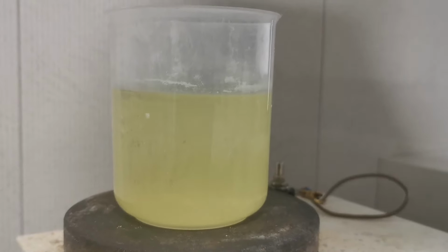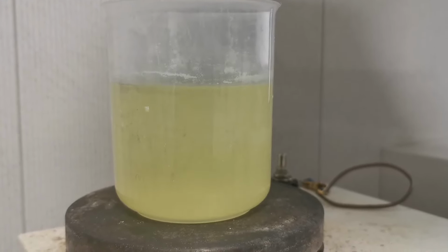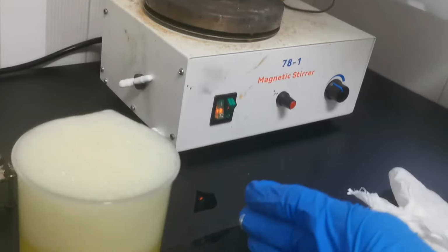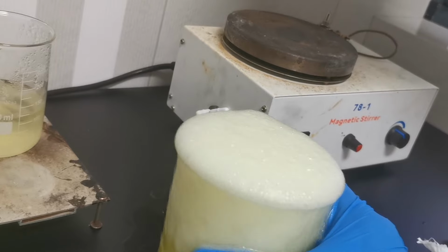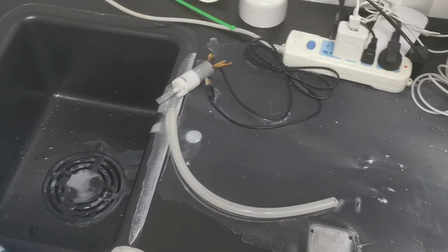And as you probably guessed, it led to a runaway reaction and subsequently a disaster. The foam flowed out of the beaker and onto my lab table, and it kept releasing a bunch of hydrogen chloride as it went. I turned my vent fan all the way up and ran out of the lab, and after a few hours of coughing because of all the hydrogen chloride I breathed in, I returned and saw the DCE completely evaporated and the table covered in some white stuff, probably cyanuric acid and benzoic acid.